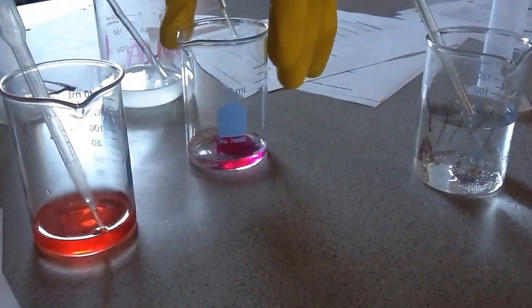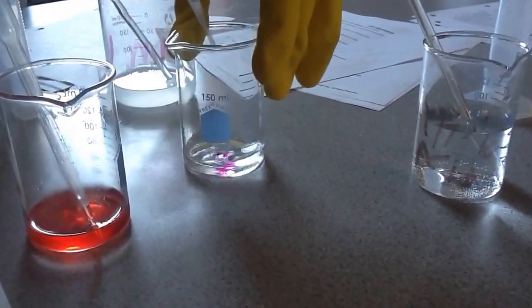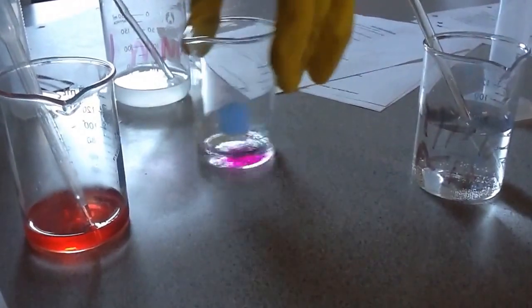Again, I'm doing it very quickly just for demonstration here, but looks like we're really close to hitting the neutralization point. That's where you have the same amount of acid and base.